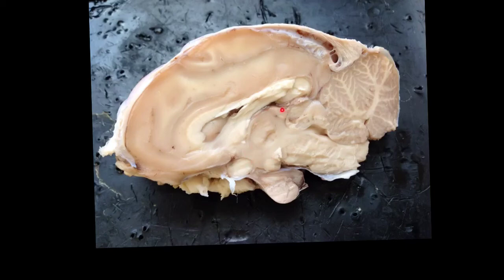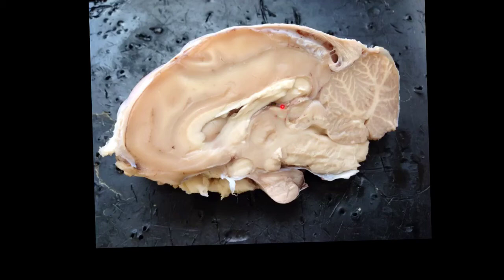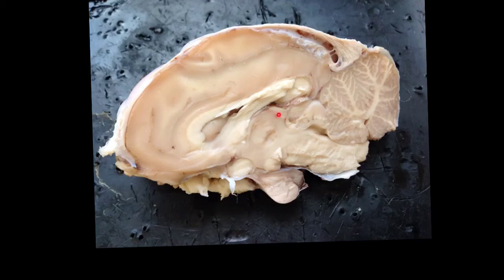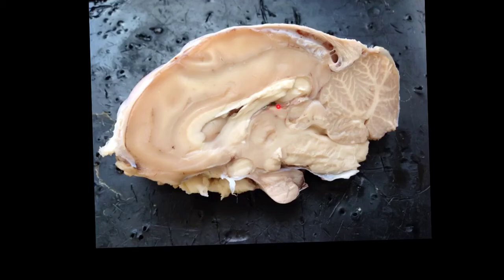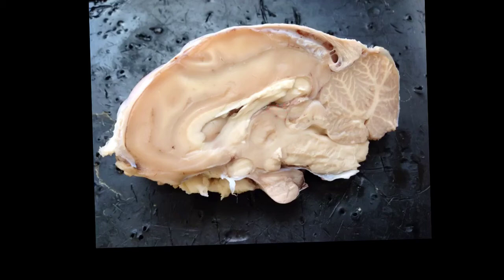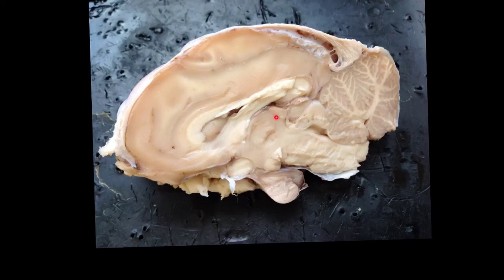Sitting right on top of the thalamus is a very small structure, which is pretty hard to see. But right up here, that's the pineal gland, also known as the pineal body, which secretes melatonin.